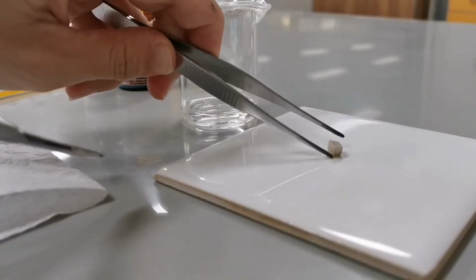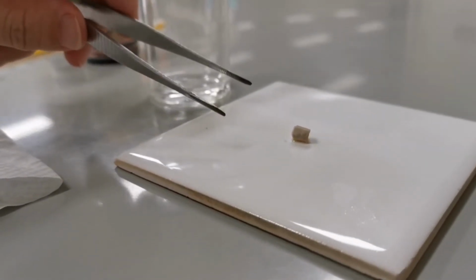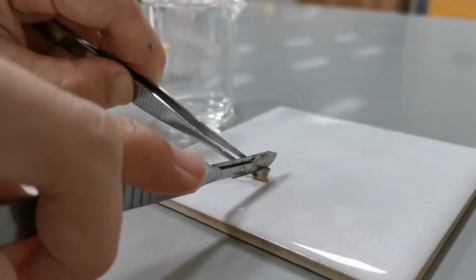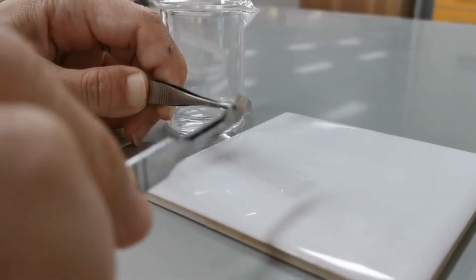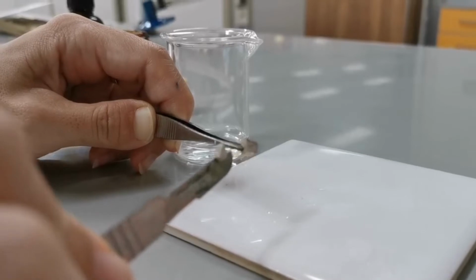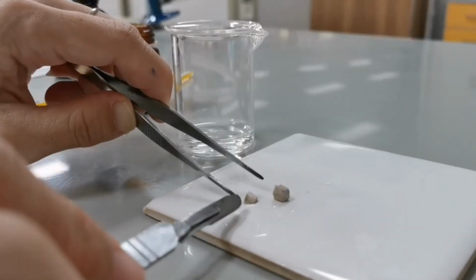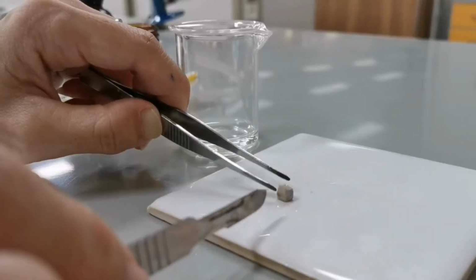And sodium is a metal, but you can see here it looks white. Typically, metals are silver or gray color, like the color of my forceps here. But if you cut this, you'll see that on the inside, sodium actually looks lustrous, looks gray or silver, just like any other metal. The reason why it looks white on the outside is because it reacts with oxygen in the air to form sodium oxide, and sodium oxide is white.